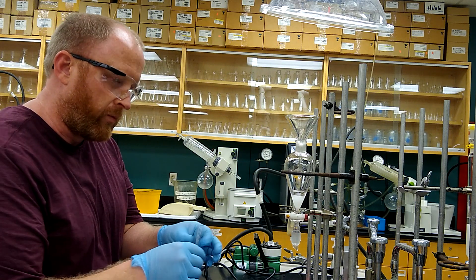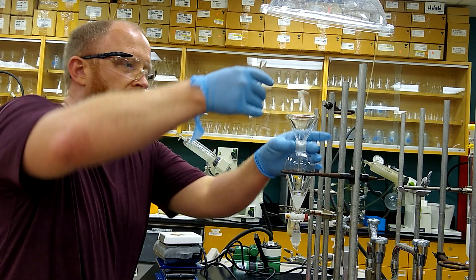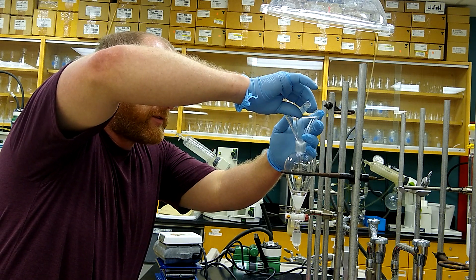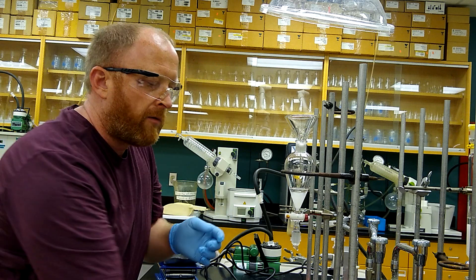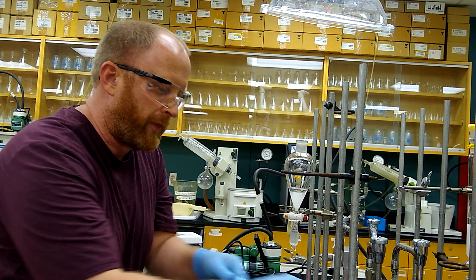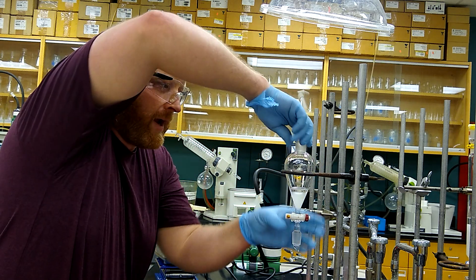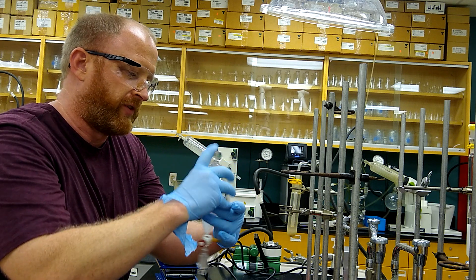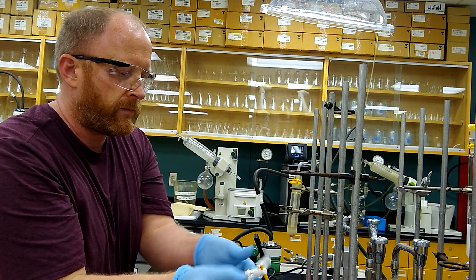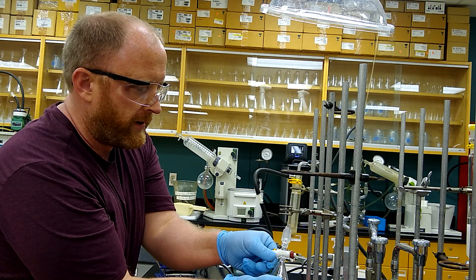Then we'll use a little bit of 5% sodium hydroxide to wash this. One thing that does is any unreacted cresol will be deprotonated, so it'll remain aqueous and stay in the water layer.